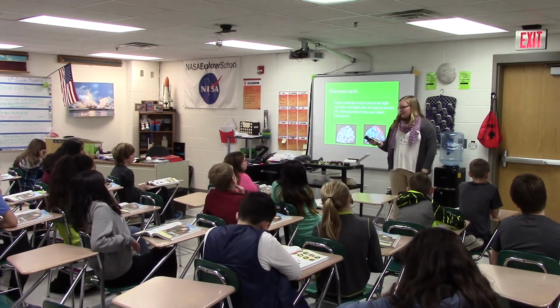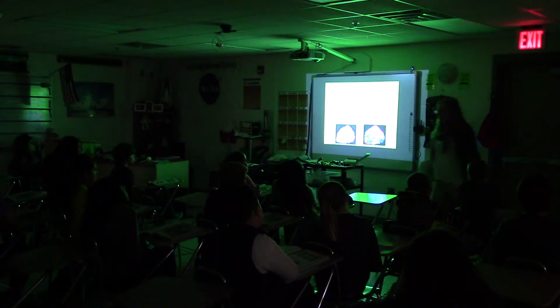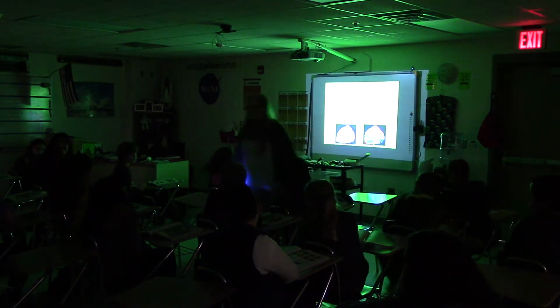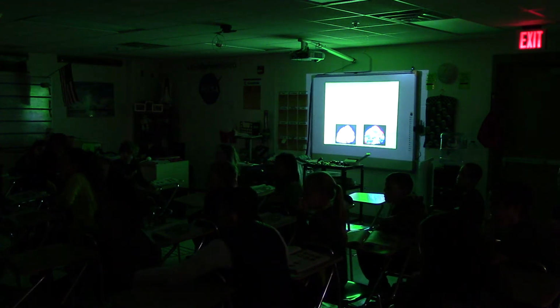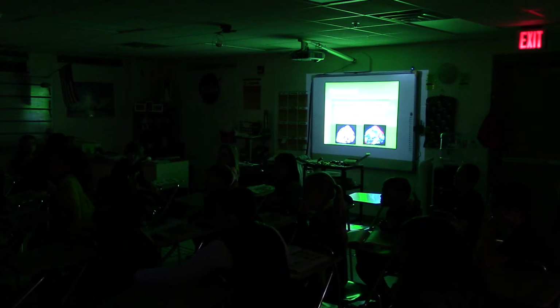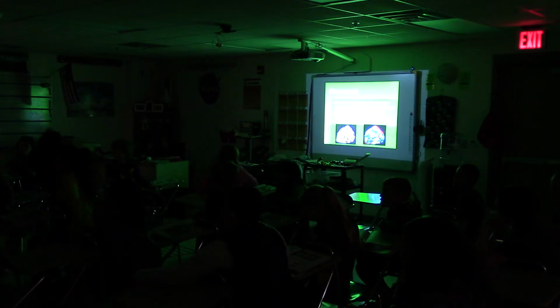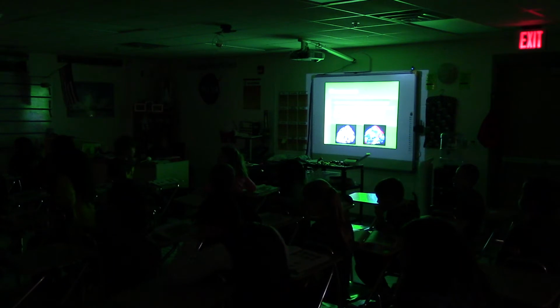So I have my black light right here. I'm going to kind of go in here in the back because it's easier to see. But I'll walk around the rows. Do you see what that looks like, Braden? It's kind of yellow. Kind of looks green. Your stuff's right back there. See, it kind of looks like it's like those glow-in-the-dark stars that you can hang on your ceiling.